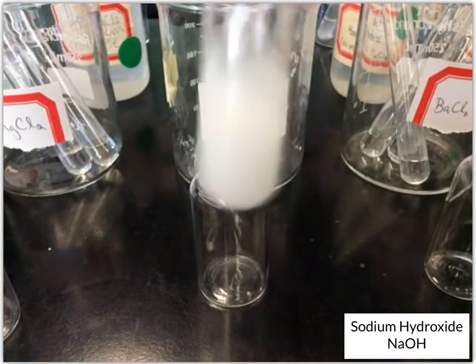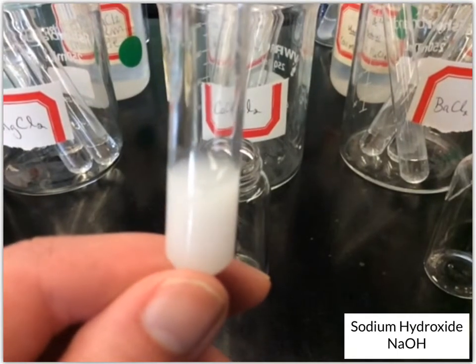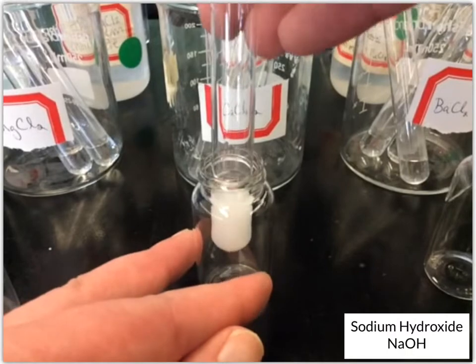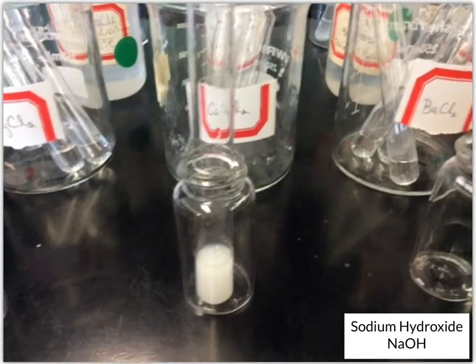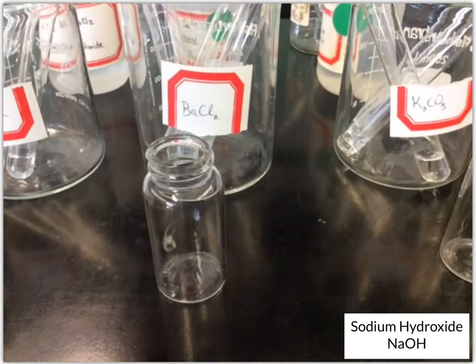Okay, now the calcium chloride solution. Okay, this one also turns into this kind of white solution. Okay, and again, we'll wait because it's likely that that's solid in there and that it'll float or it'll sink to the bottom. Okay, next up, barium chloride.